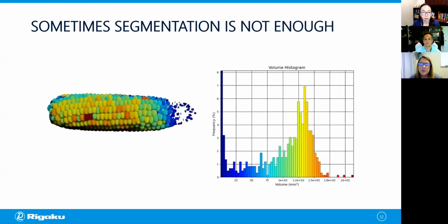Additionally, we often want to further partition our regions of interest. For example, we may want to examine labeled regions within regions. Here's maize, a corn cob, and what we want to do is take our kernel region of interest, or ROI, and divide it into individual kernels. Once we do that, we can make quantitative assessments of the size, the volume distribution, and things like that. Other things we might want to do are exclude some regions of the ROI from our analysis, or regions that intersect with the border. Luckily, there are many tools available for this post-segmentation refinement, and we'll use some of those today.